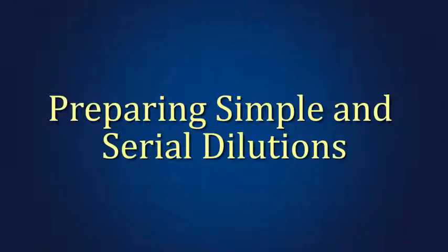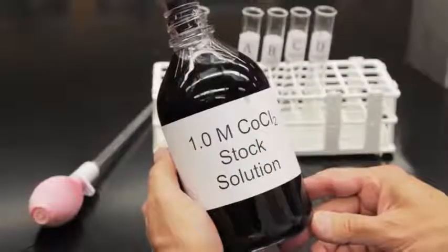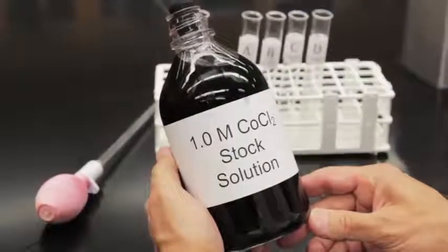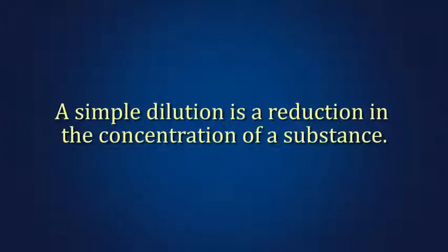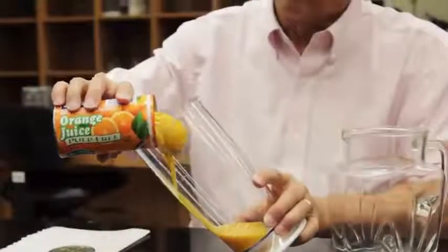Dilutions are prepared by adding solvents to concentrated storage or stock solutions. A simple dilution is a reduction in the concentration of a substance. We've all made simple dilutions. For example, we make orange juice by diluting a can of concentrate. This concentrate is the stock solution.